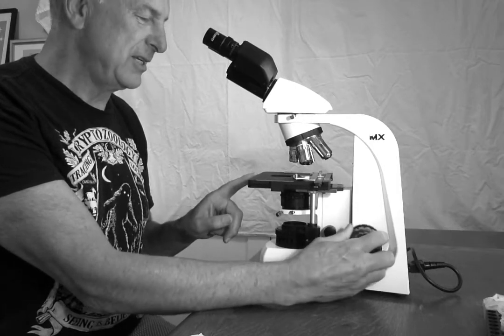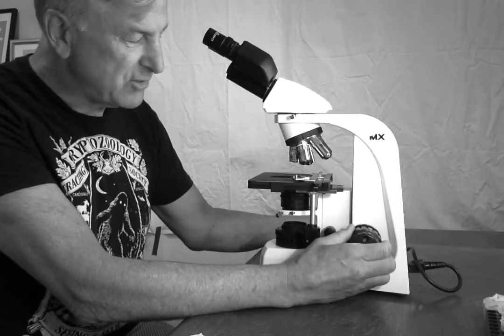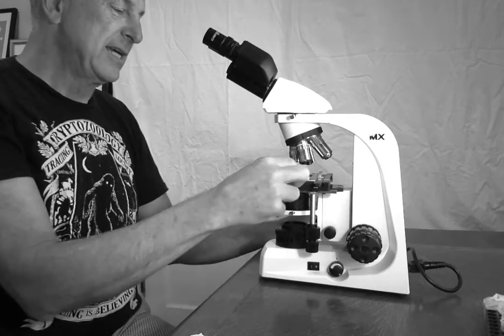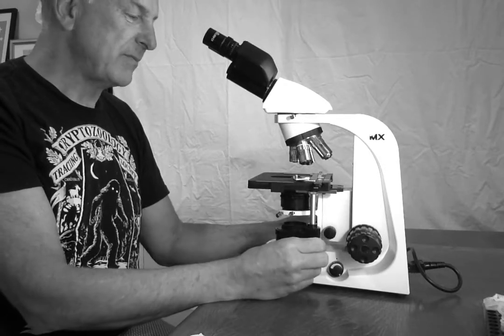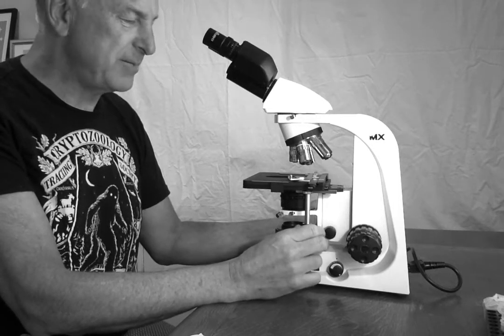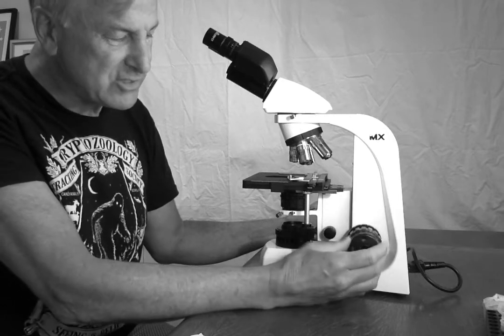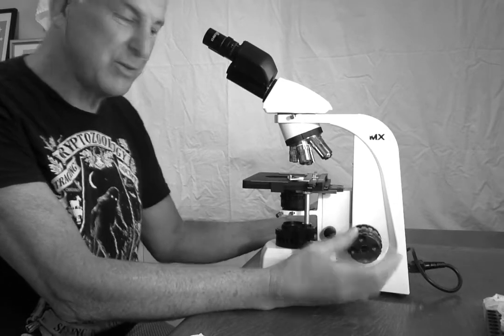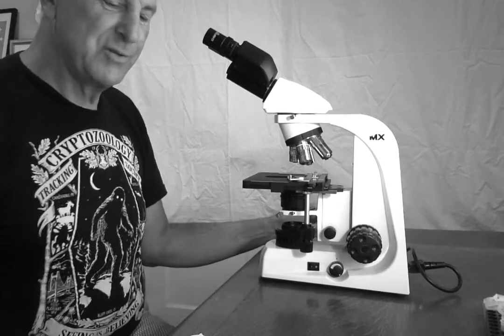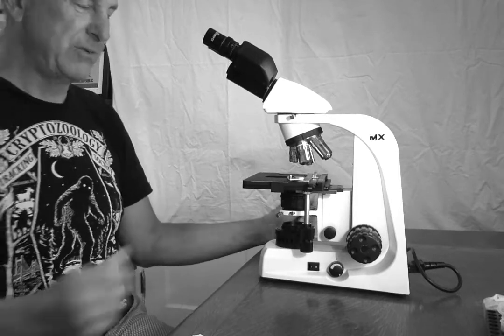You only need to use the coarse focus on the lowest powered objective, because we're using what's called a parfocal microscope. So if I focus at low power, I should pretty much be in focus at higher power, the higher objectives, and only will need to use the fine focus to explore under higher magnification. Those are my warnings.